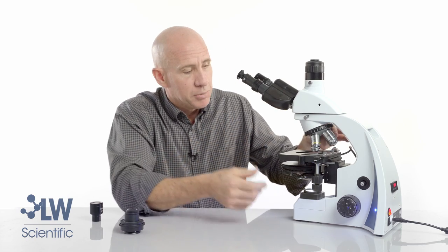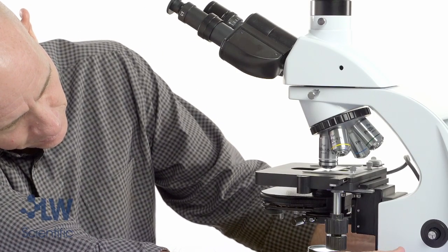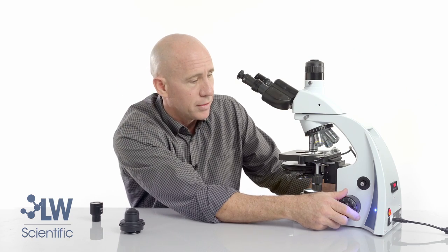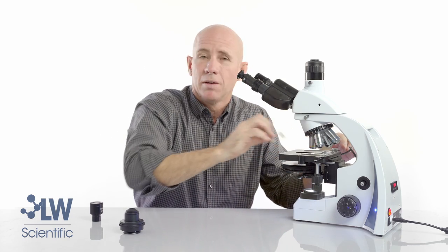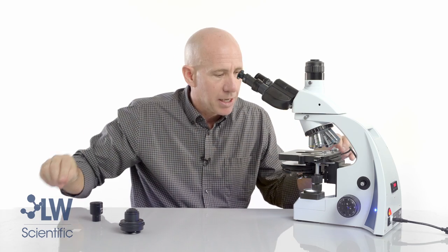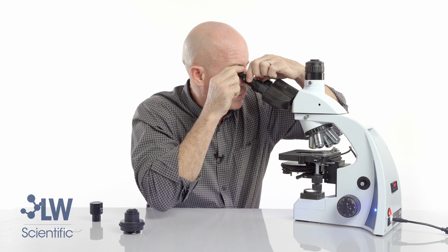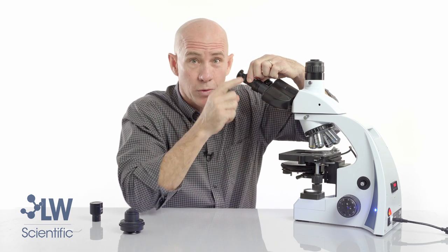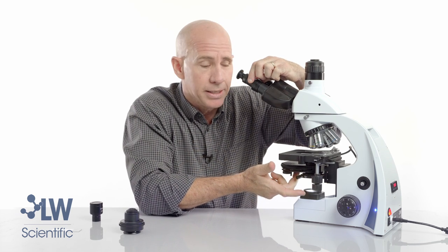One way to set the stage height is to use a long objective and set it so the slide is almost touching the objective. Back to the 10x — for the alignment process you don't really need a slide. So we have our stage up and our condenser up. Now I need to find those rings: the dark donut inside the objective and the halo created by the condenser.